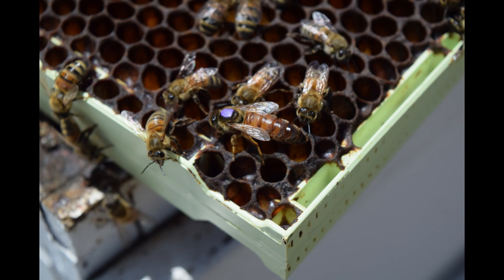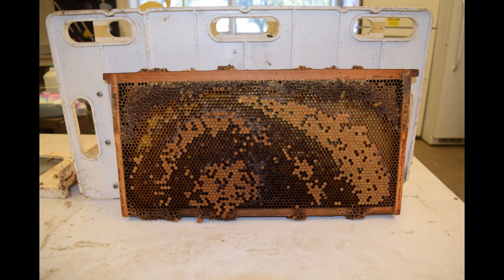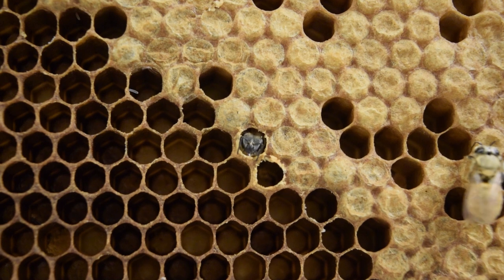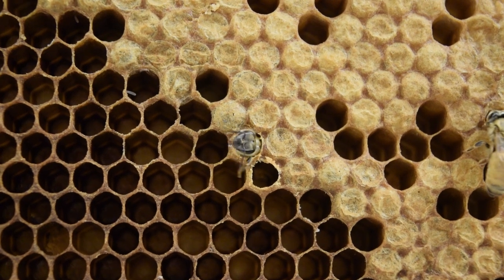You can see she's clearly larger with that extended abdomen. This is what the frame of female workers we took from the first colony looks like — it's a little irregular, but normally what you want is kind of an empty center with a ring around the edge of bees just now coming out. All the bees in the middle have already emerged, and the last bees that are just about to come out are the only thing left on the frame. The best sign you can get is bees actually emerging, and here I'm showing a little bee fully developed, chewing her way out of her cell. You can see her get almost halfway out and then decide she'll do the rest of the work later. I feel you, little lady.